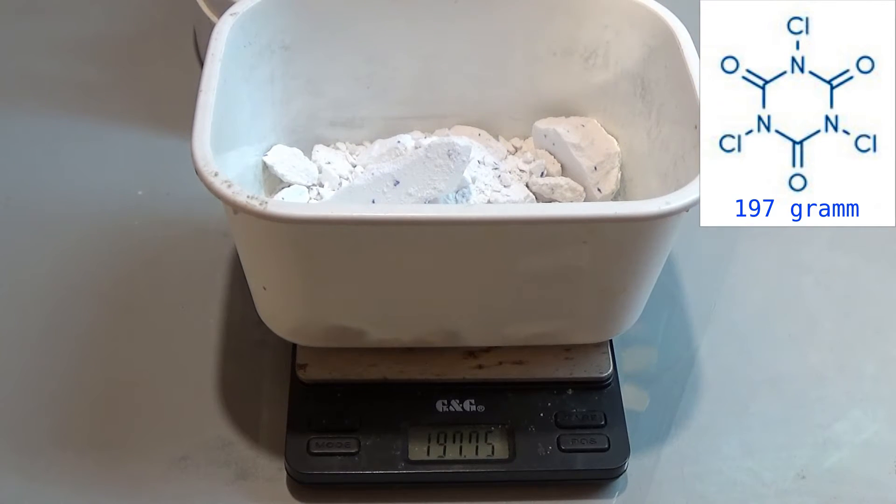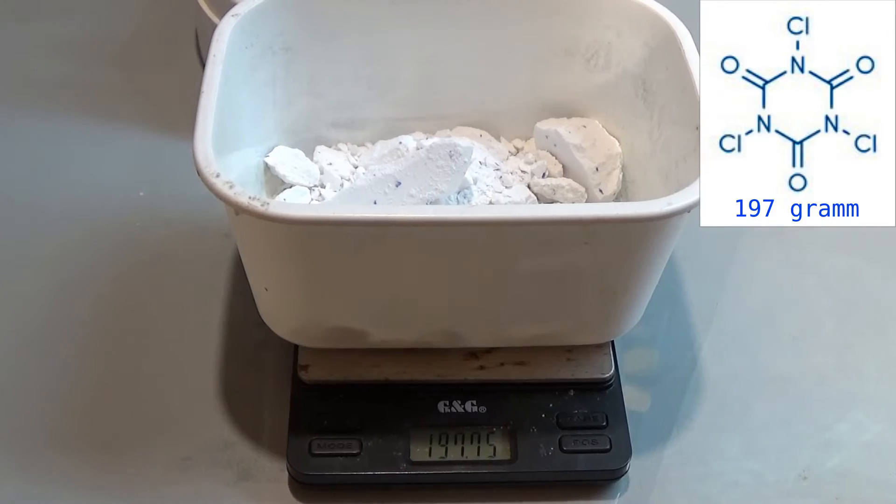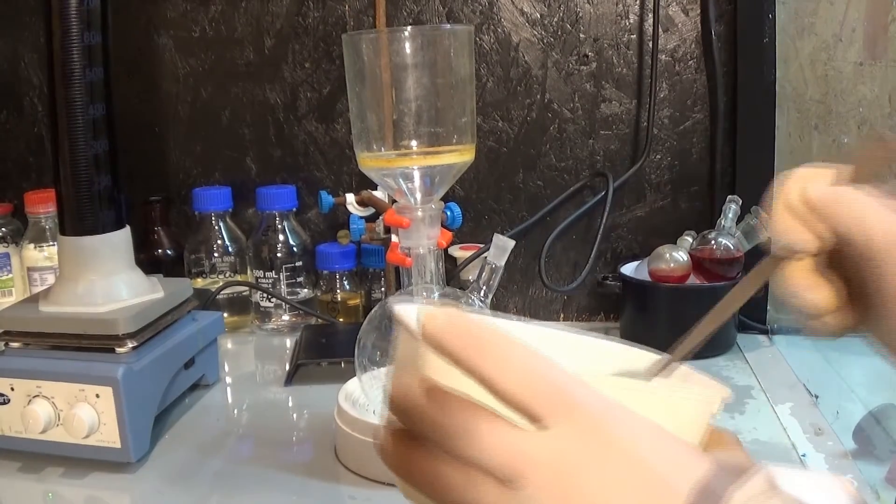So I weighed out some trichloroisocyanuric acid, filled it in my chlorine gas generator setup.